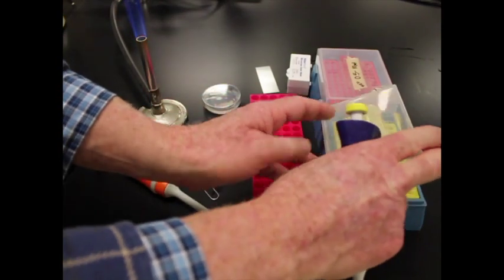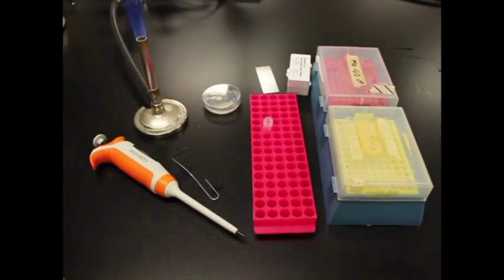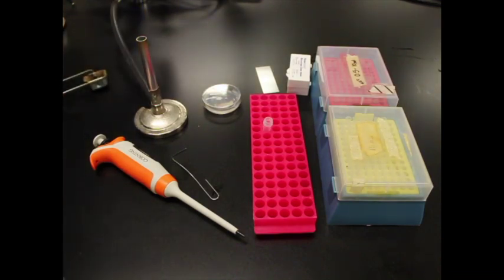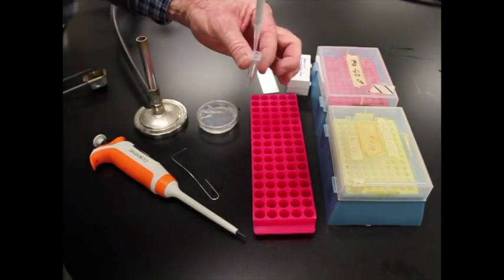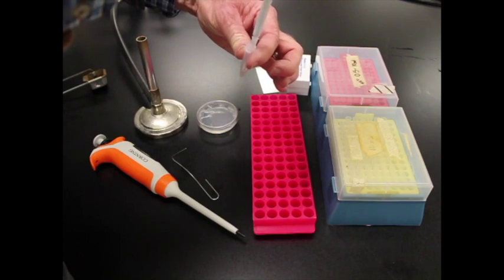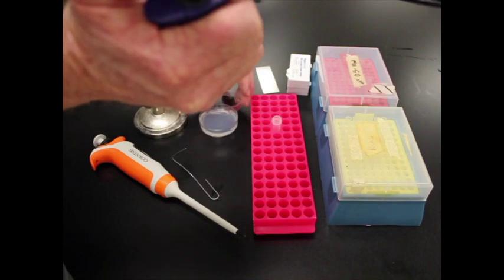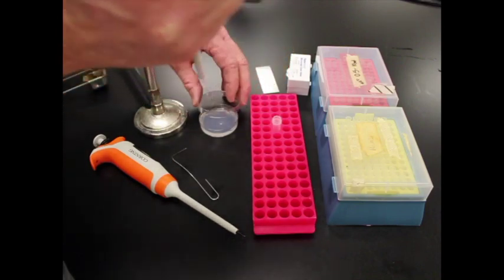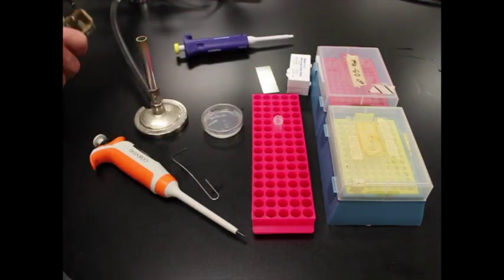So I am going to go over here. Get a pipette tip. And actually I'm going to turn off my heater because I don't need it yet. We'll take the plate and I'm just going to get 50 microliters of the spores. Mix it up and down. And then get 50 microliters out. And we'll put those right on the plate here. And get rid of the tip. And now what I'm going to do is now light the Bunsen burner.